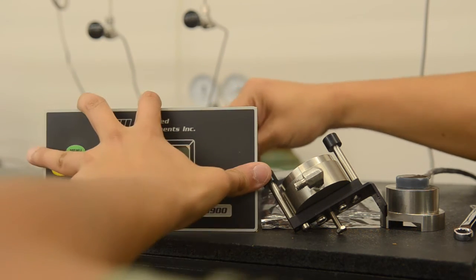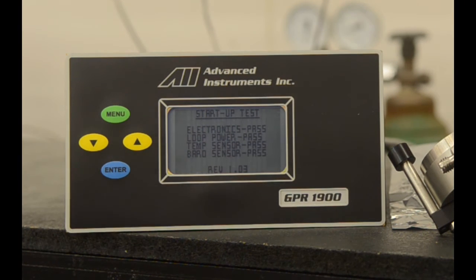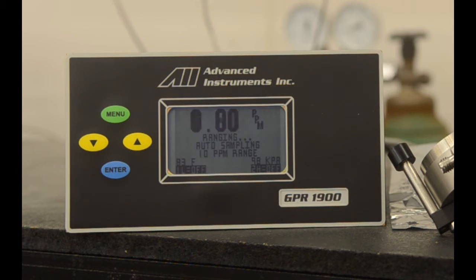When you apply power to the analyzer, you'll start up with a system check. Ensure that all parts are passed, and then you'll be taken to the main screen.